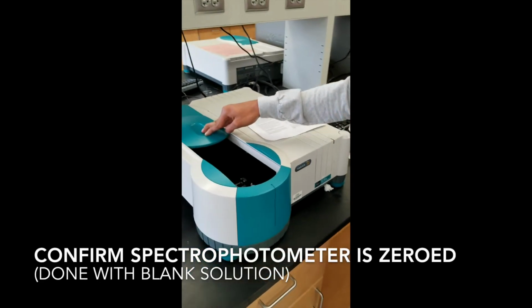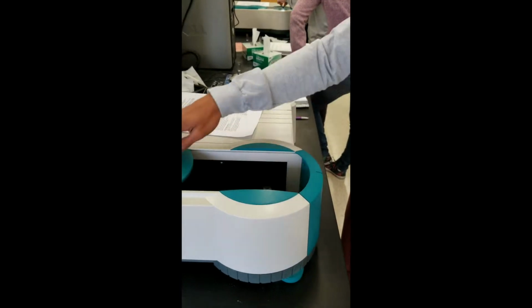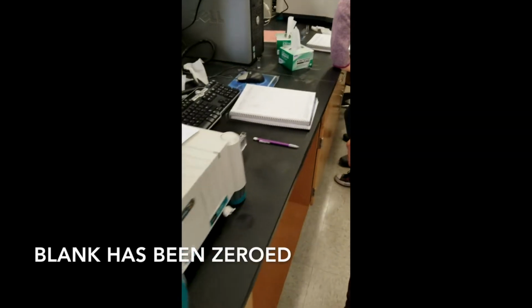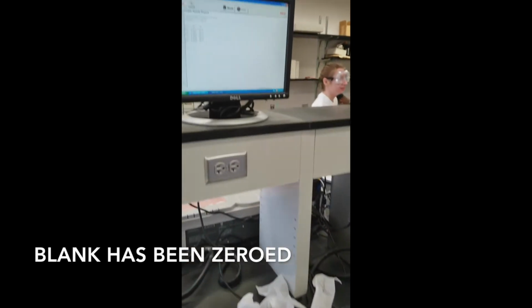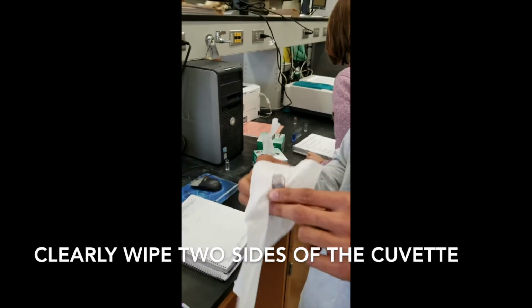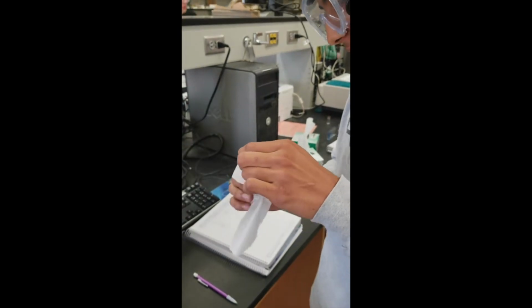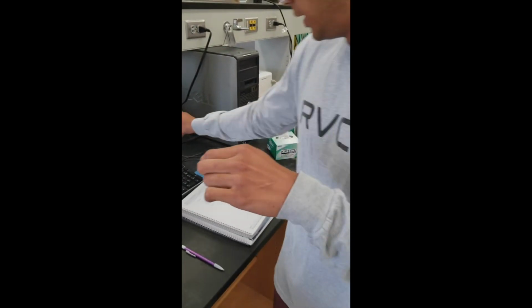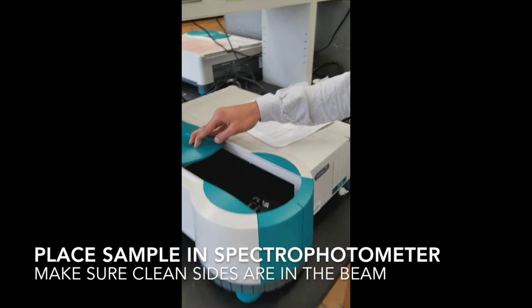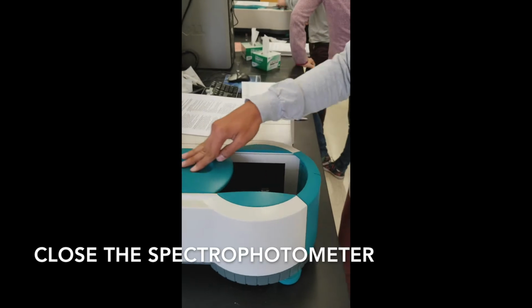And I filled it up to this line, transfer the stock solution into this cuvette, and we're ready to go. Open the spectrophotometer and place the clean sample inside with caution, and close the spectrophotometer. Now let's come back here and make sure that this has truly been zeroed. So now I'm going to place it in the spectrophotometer, but before I do that, I make sure that I wipe and clean the sides of the cuvette carefully.